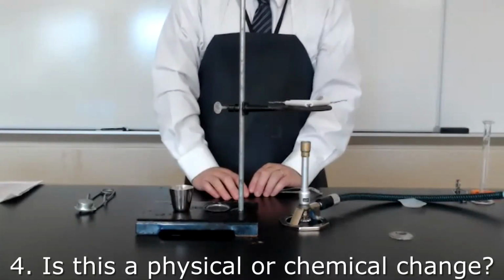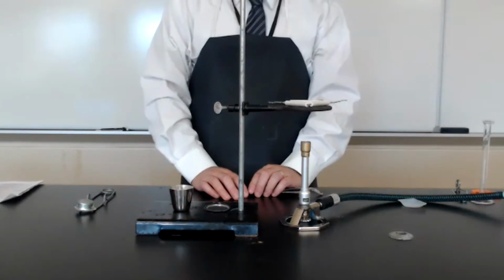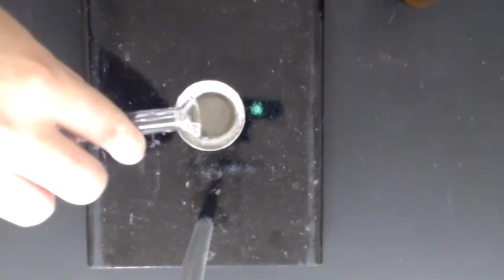Is that a chemical or a physical change? You are now looking at a top view of the crucible. In the next step, we're going to add water and redissolve the sodium chloride solution.